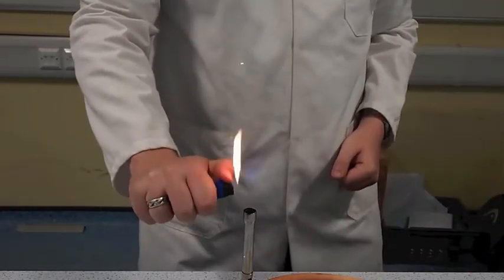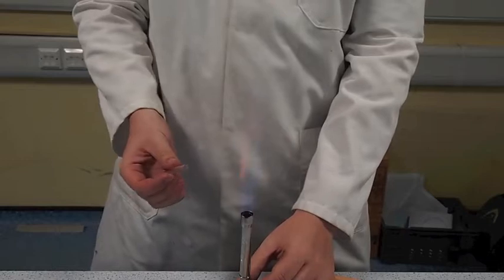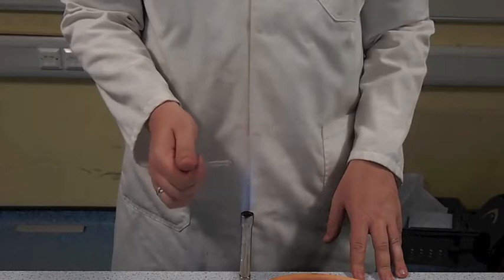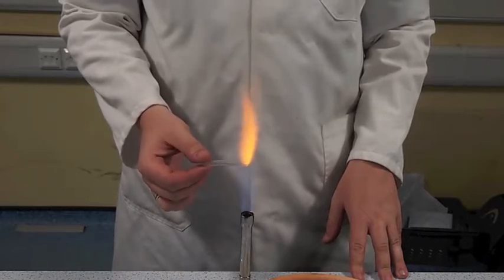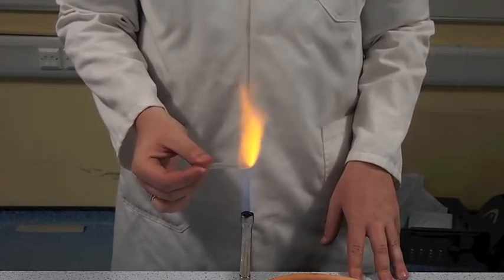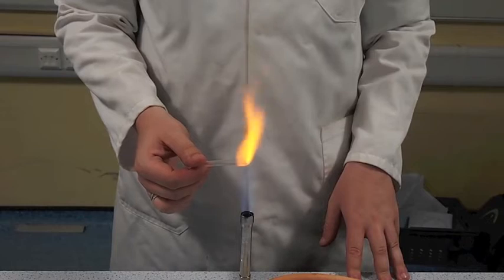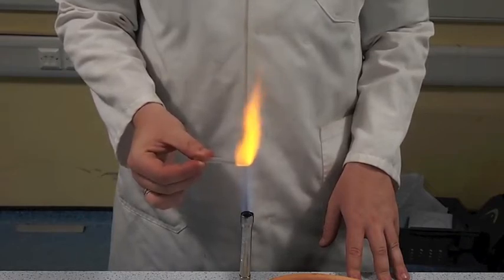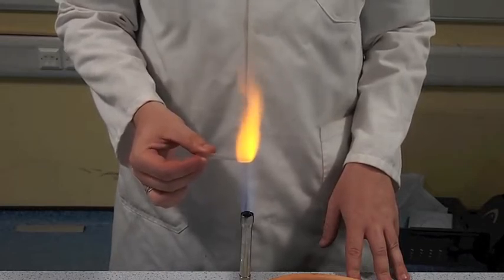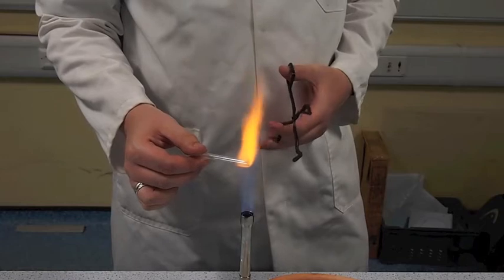To make them, first you have to melt the end of a tube of glass. Now this is fairly difficult because glass melts at about 1500 degrees C. What you're trying to do is to turn it through the flame in order to melt it and then seal it. The idea behind these Krakatoa tubes is you have to seal a glass tube with some water inside. You can see the end starting to get floppy and turn over, and all I want to do is get it to the stage where it's starting to melt and bend in, and then I can crimp it with my metal tongs.